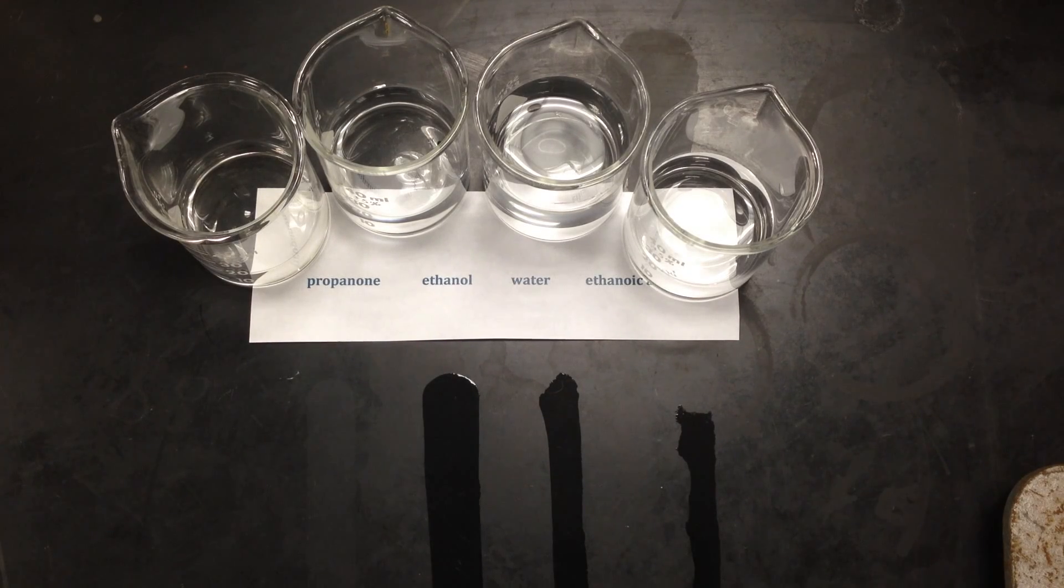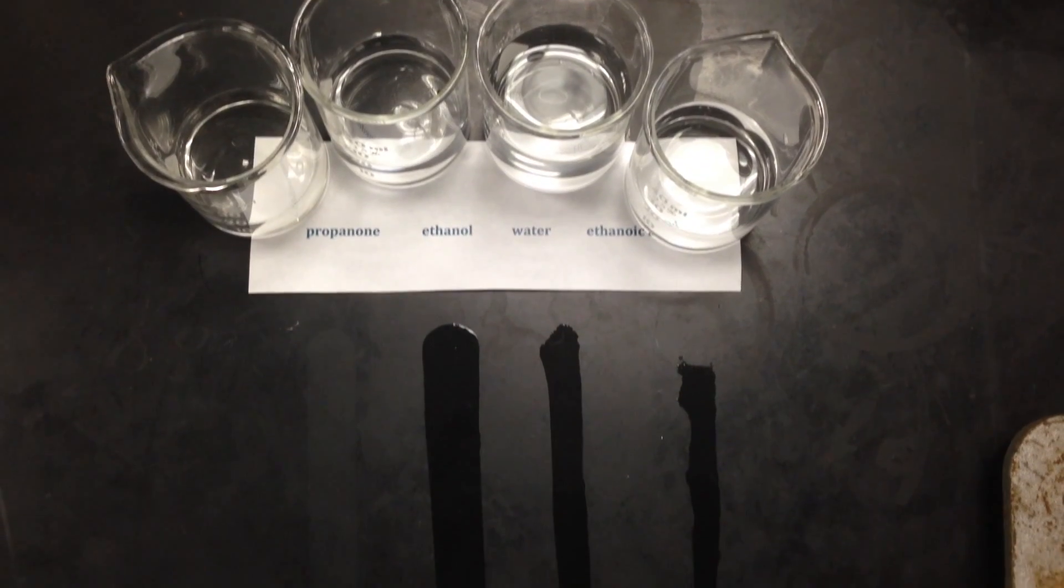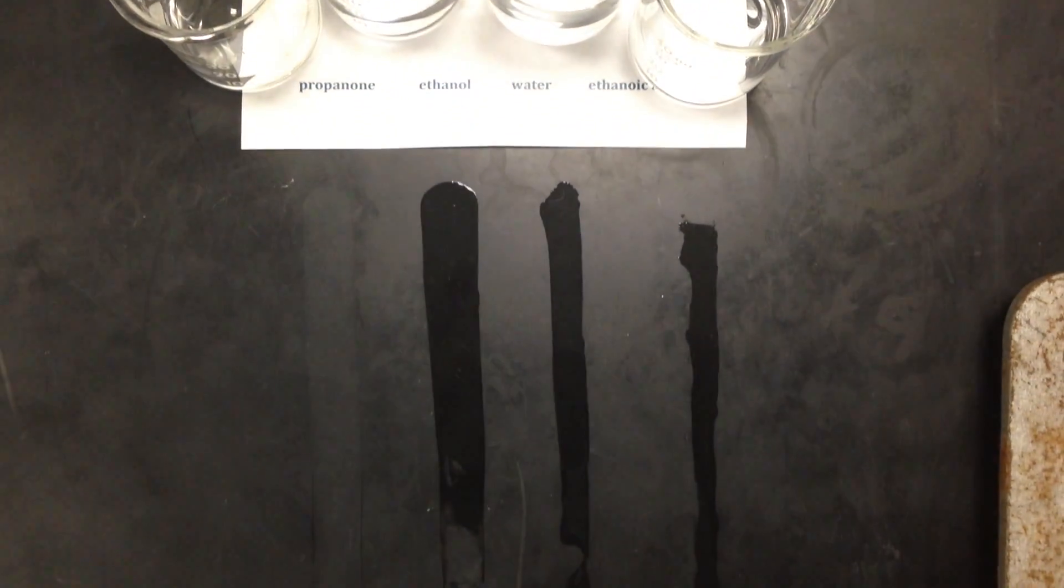Now, if we look carefully and we wait, we're going to see one of these three liquids starting to evaporate before the others. So let's give that a couple minutes here. It shouldn't take us too long, but if I move this back, we can see that one of the liquids is certainly evaporating before the other two.